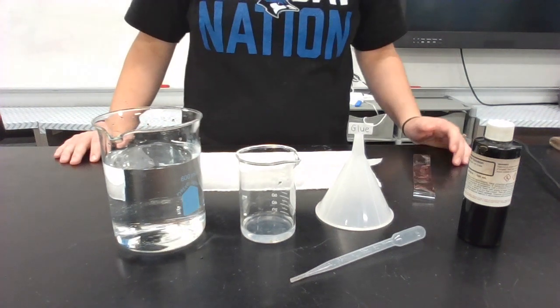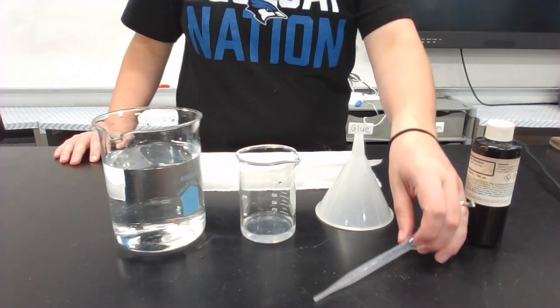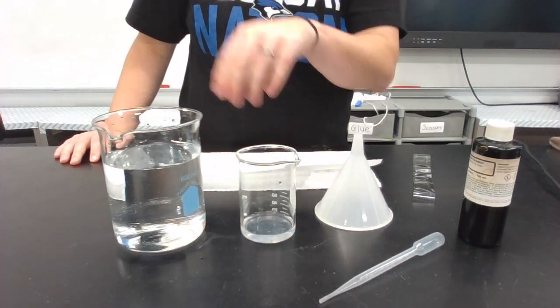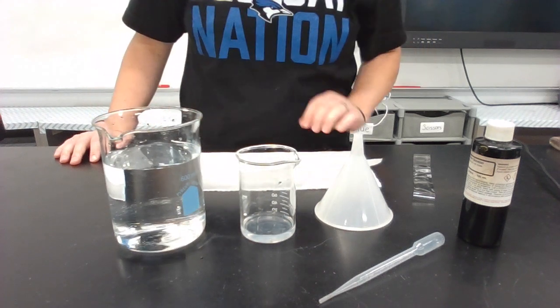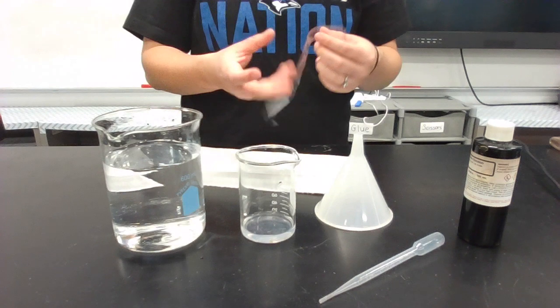Our materials for this experiment are iodine solution, a pipette or a dropper, a funnel, about 20 milliliters of starch solution, about 500 milliliters of water, paper towel, and dialysis tubing.